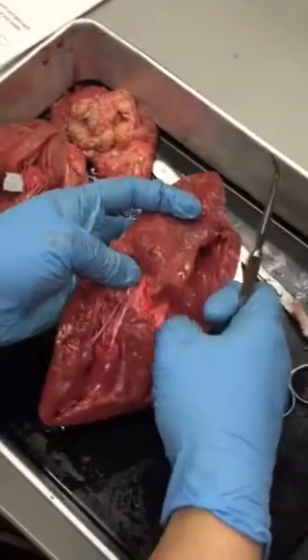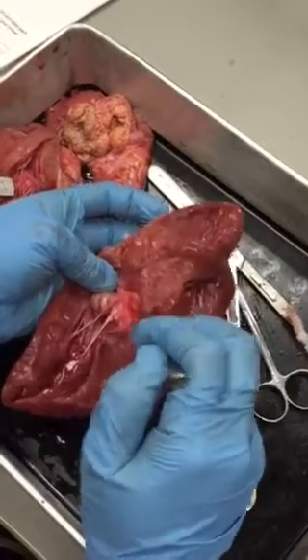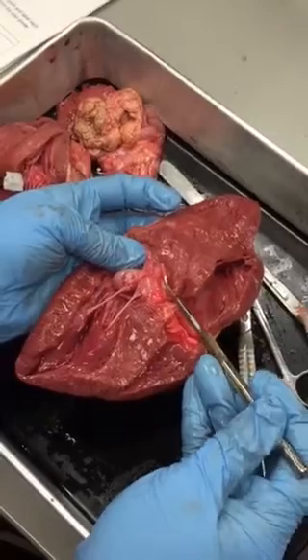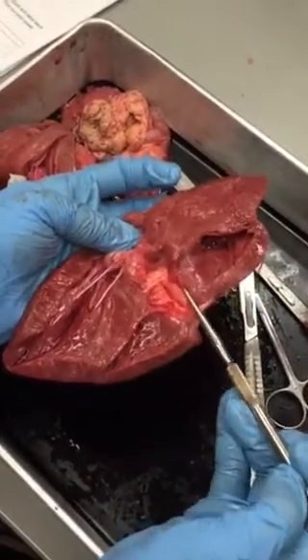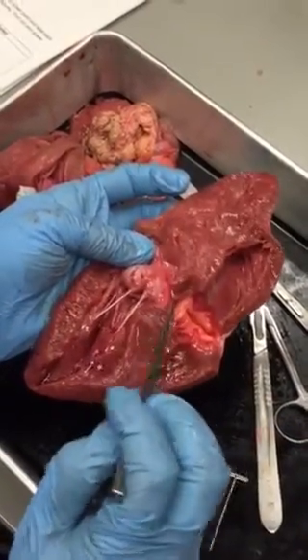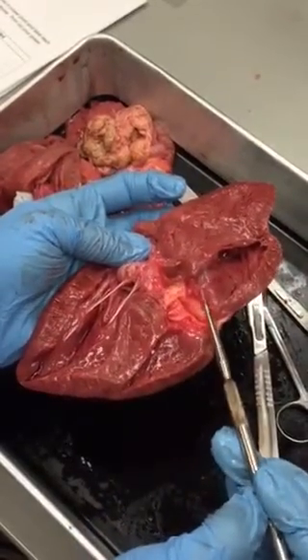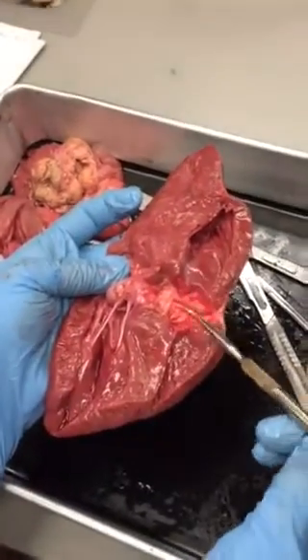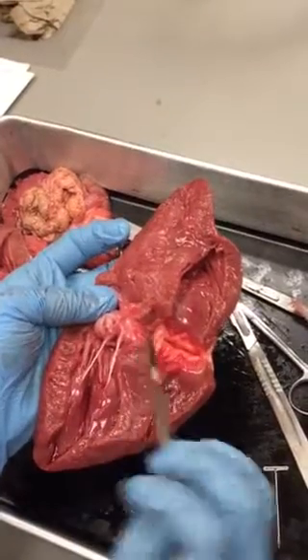In this one, you can see that from the left ventricle here, you have these little flaps. These are your semilunar valves. So you have one going into each of your major vessels, one on the right side and one on the left side. The one on the left side is going to be your aortic semilunar valve, and this is the pulmonary semilunar valve that comes from the right side. The pulmonary semilunar valve is going to go into the pulmonary trunk. The aortic semilunar valve is going to go into the aorta.